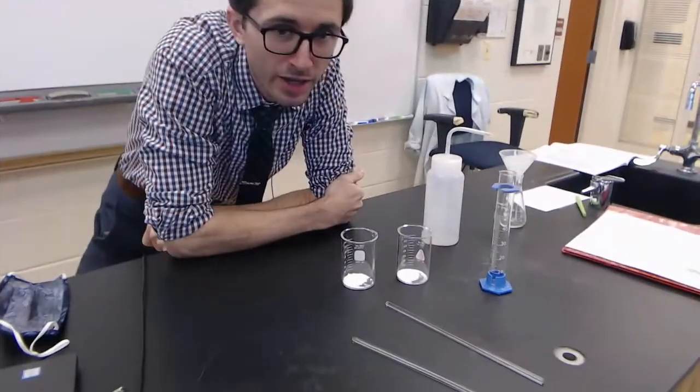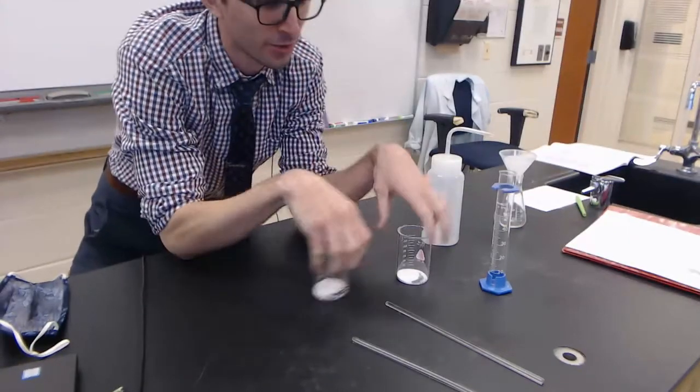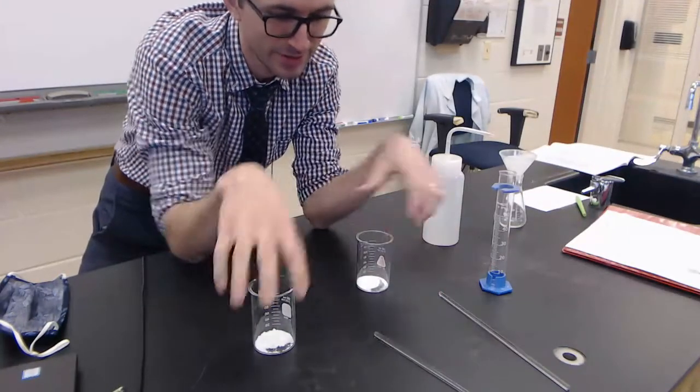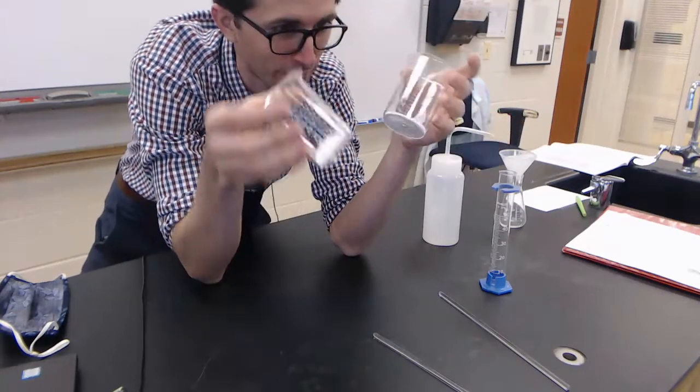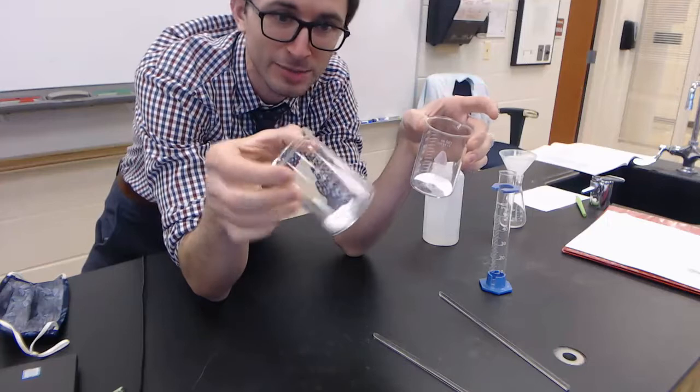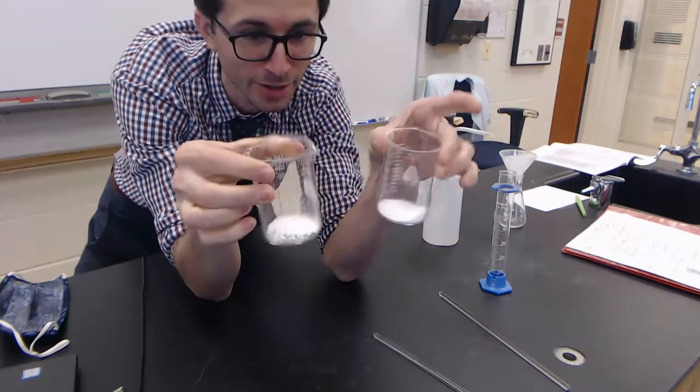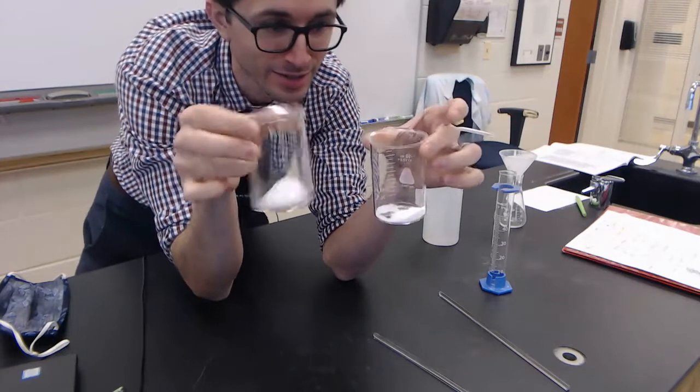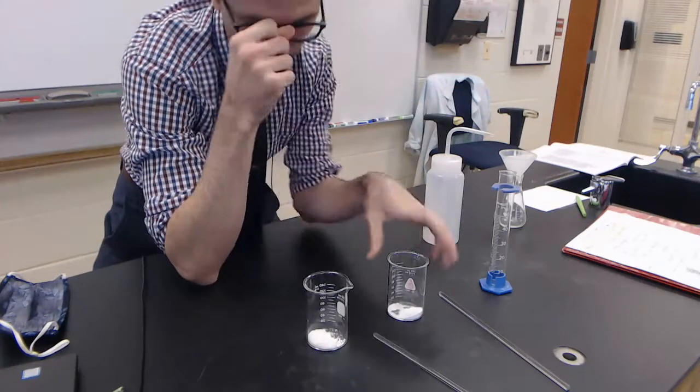Hello everybody, we're looking at the limiting reactant lab for those of you remote. Looking at my procedure, I've got my X amount of grams of reactant X and Y amount of grams of reactant Y. You can see they're both white solids. I'm going to run through the procedure.